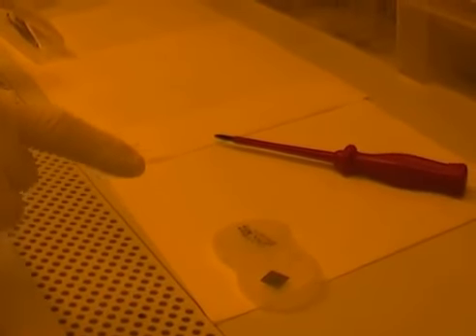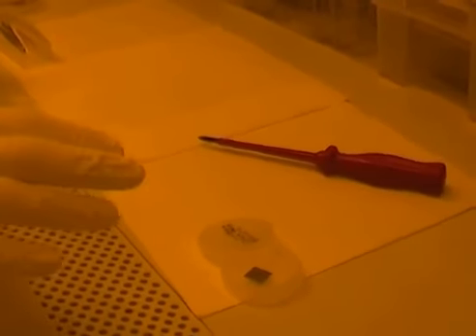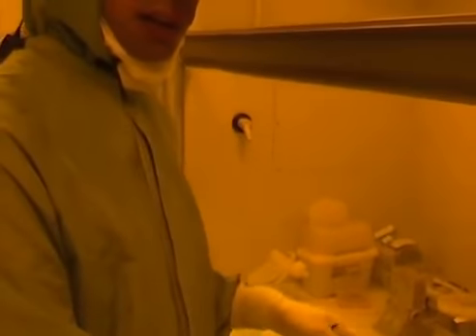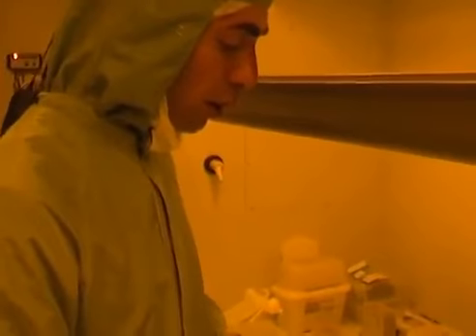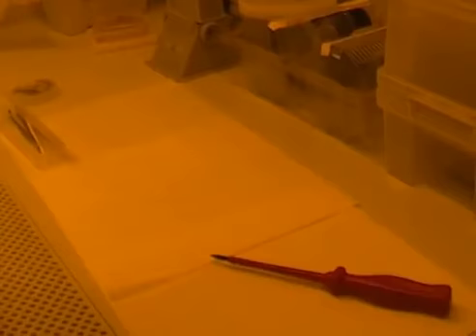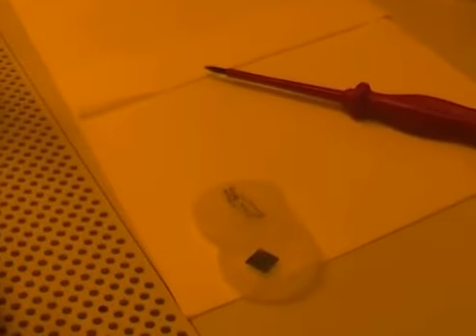this sample would have undergone several processes, such as plasma oxygen ashing or a hydrochloric acid dip. For example, in case I have to make ohmic contact, I have to remove the native oxide from the surface of the sample. So right after I've done the oxygen ashing and the hydrochloric acid dip, my sample is ready to be mounted. There are some sets of wafer and sample holders here, in this set of drawers.